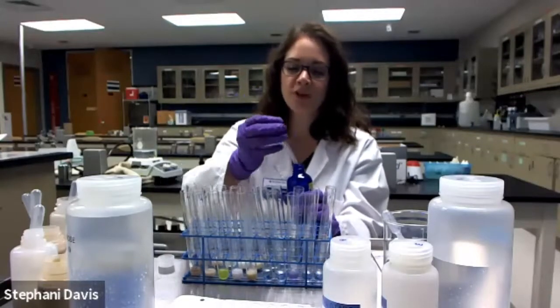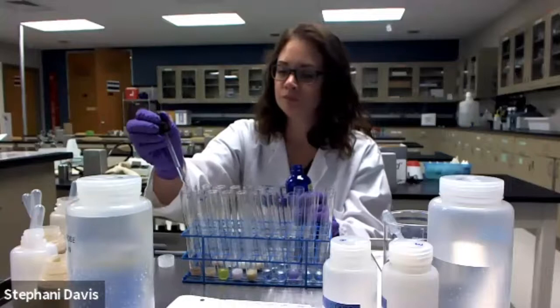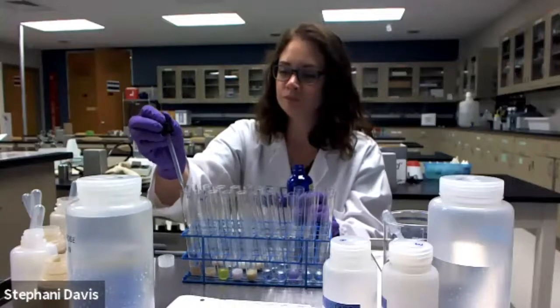And you'll notice that I'm not going all the way into the tube. I want to be careful not to contaminate this dropper. Some of them, you've noticed, have a color change.